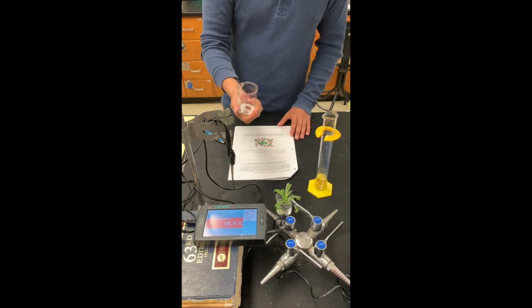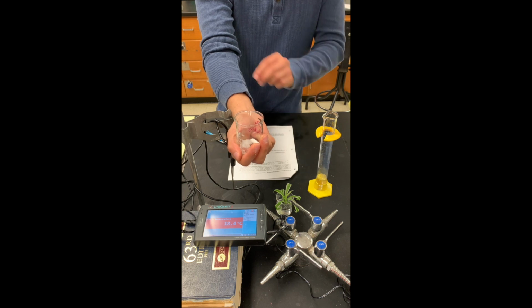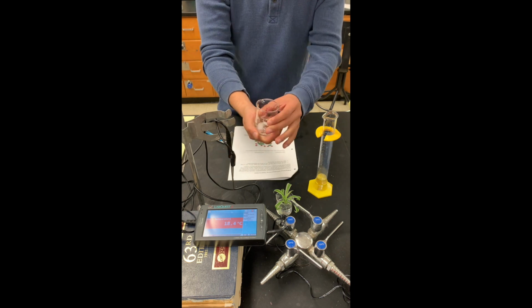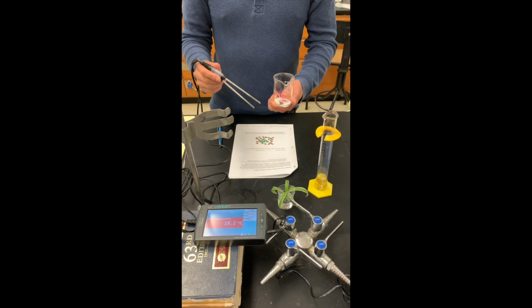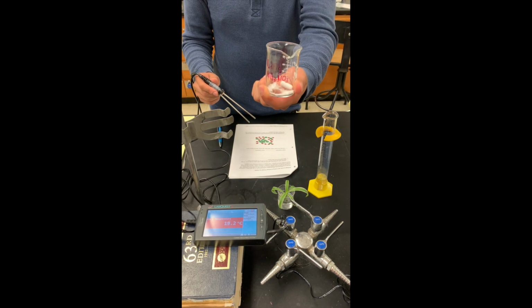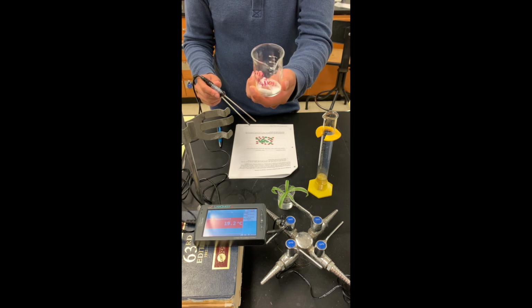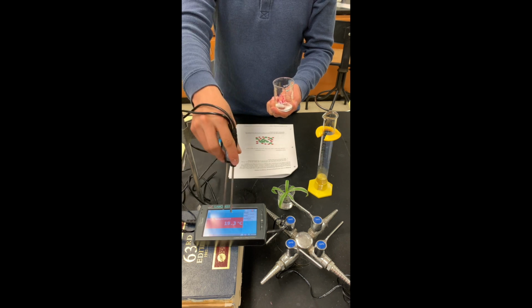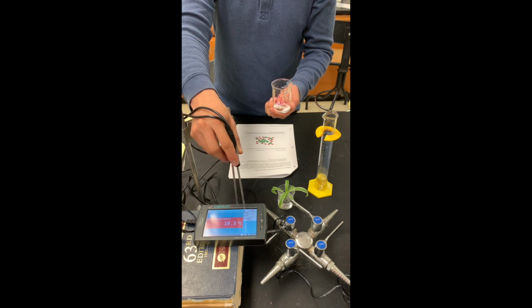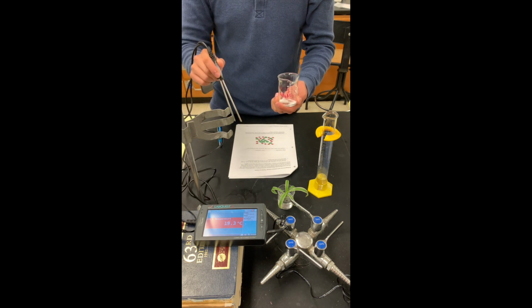Moving on, we will be holding the beaker in our hand, and we will be getting a thermometer in here, which we have in the form of a LabQuest. So we have our beaker containing a small amount of ammonium nitrate with a stir bar, and I have my LabQuest probe set to measure the temperature. As you can see, we have a consistent reading of ambient temperature, so our LabQuest is working well.